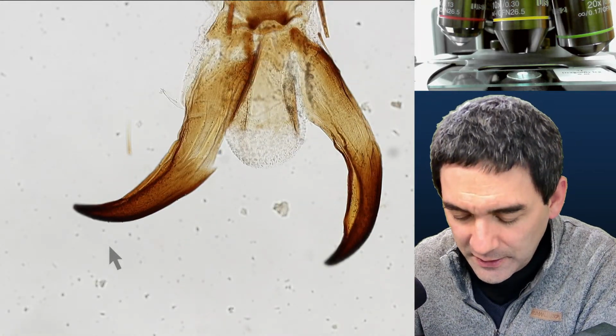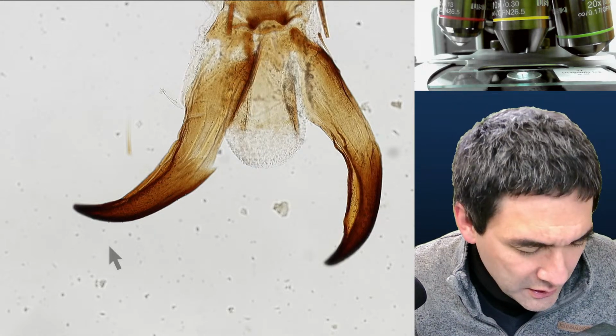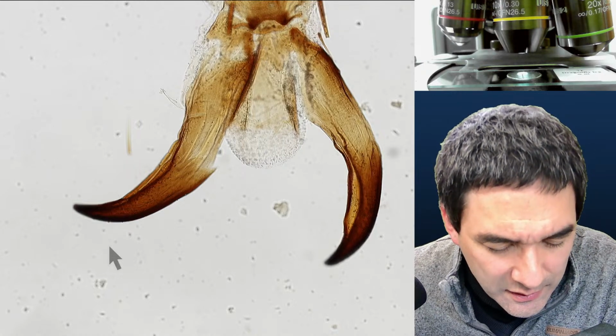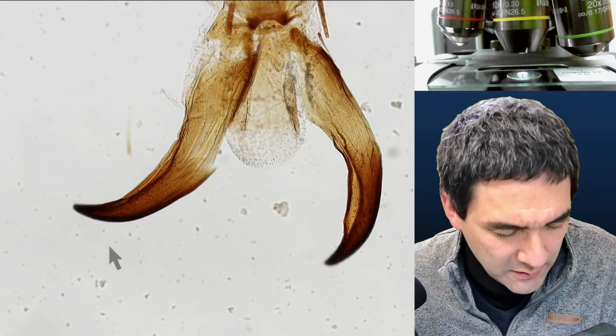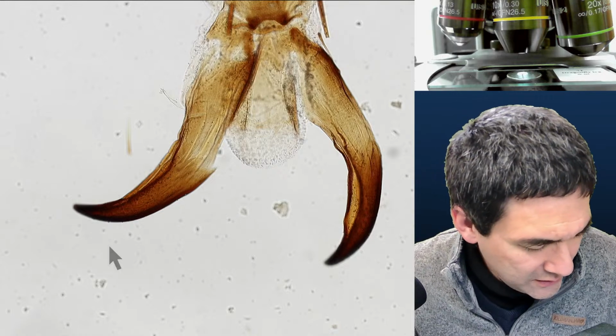We already talked about that. Mosquito leg, we talked about this, and there was one thing that I wanted to show you. Where is this? Just a second. I don't know if I can find it again. But that's the one over here. Just give me a second.